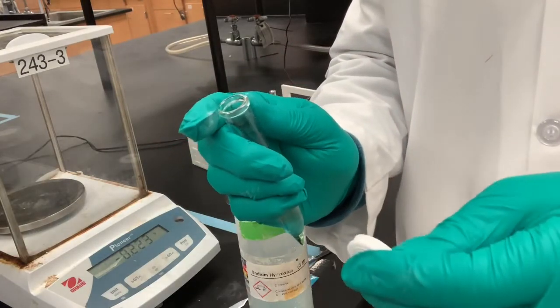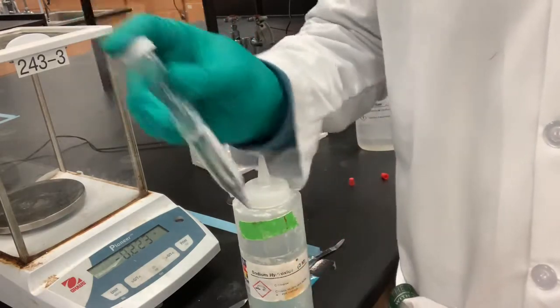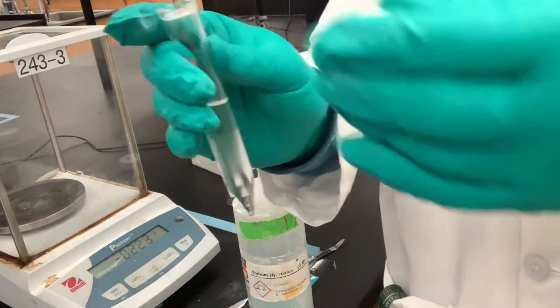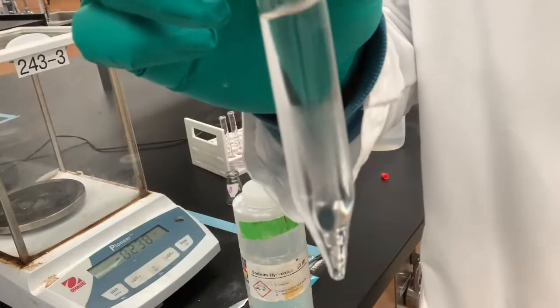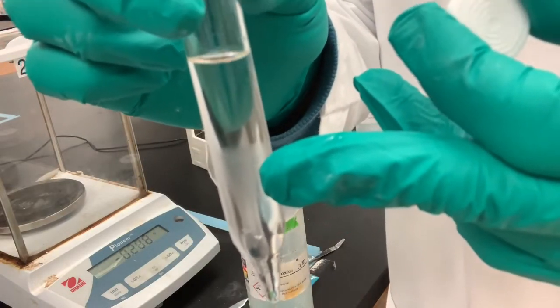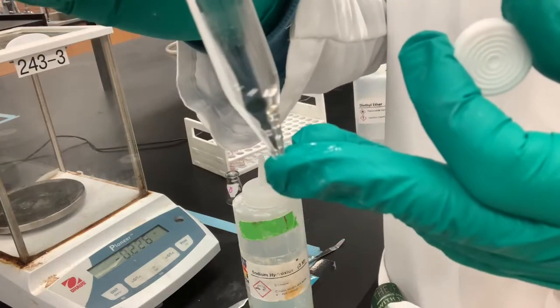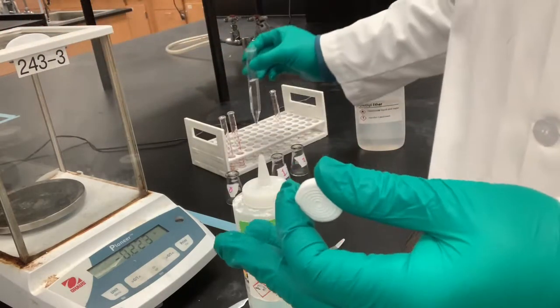Vent it again. It's starting to smell a little bit like naphthalene in here. 1, 2, 3. And vent it again. So I shook it again. So now if we look at it, we could see that there is a cloudy emulsion layer in the middle. I need to be patient and wait for there to be 2 distinct layers, and that could take a couple of minutes for it to separate. So for now, I'm going to set it down and let it do its thing.